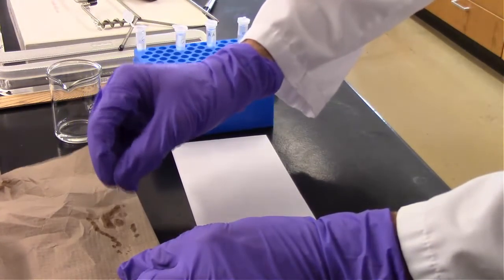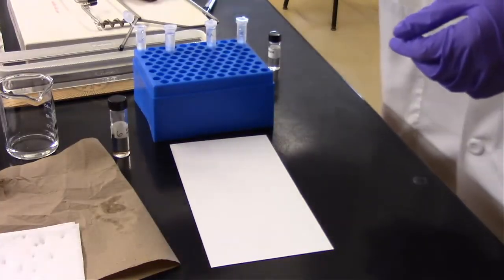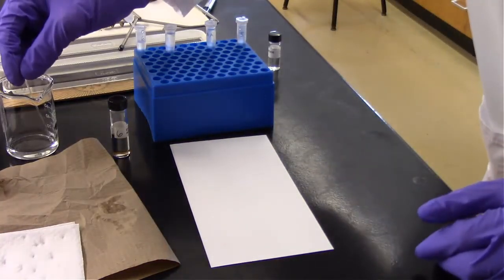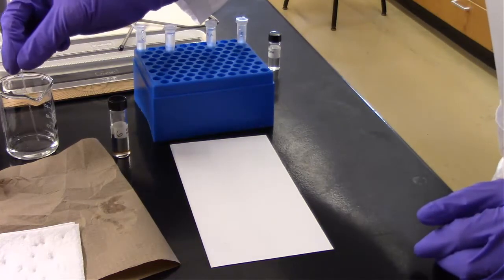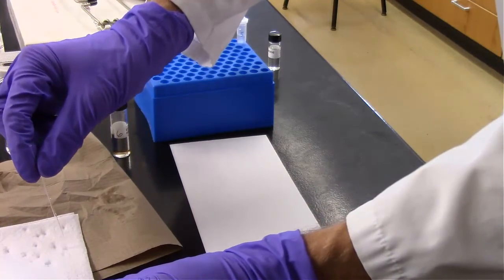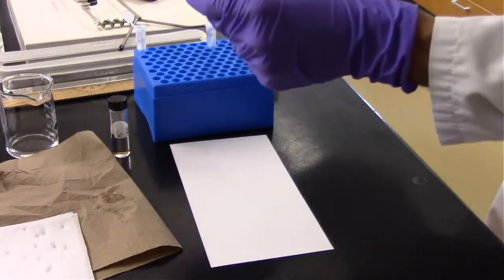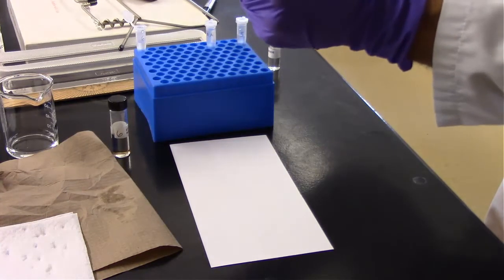Alright, so once I get the rest of this out, I'm going to go ahead and rinse this pipette out thoroughly each time. So basically let the hydrochloric acid solution run up it, and then spot it, let it run out, and then after we've done that about 5 times, which I did on the video, we can go to our next.